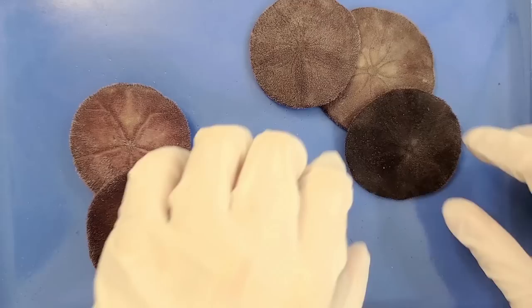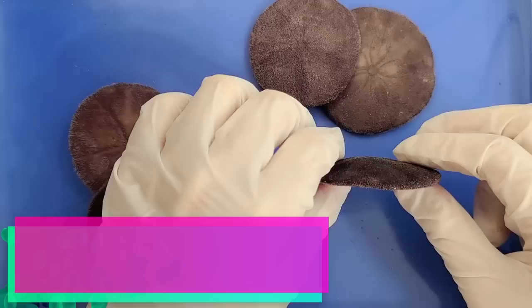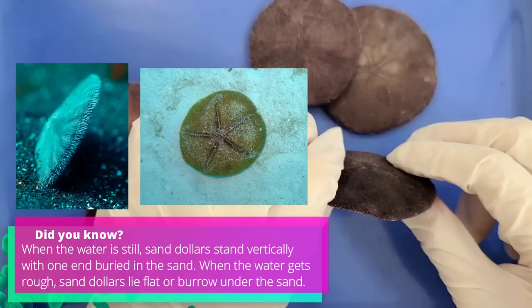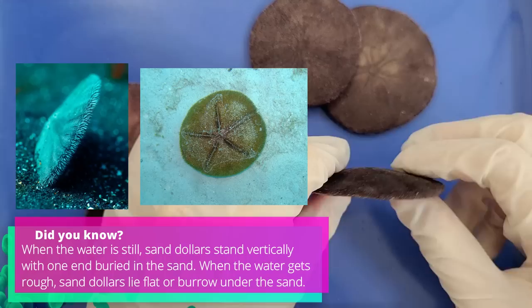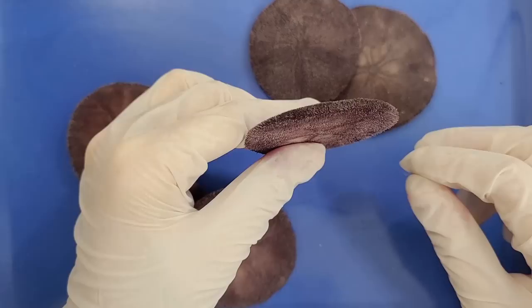Sand dollars have actually evolved to become flattened because they often burrow underneath the sand instead of traveling on top of it. Their flat shape lets them do this easily. Since sand dollars often live in harsh intertidal zones with waves crashing over them with a lot of force, burrowing into the sand gives them more protection, and their flat shape also streamlines their bodies so that they can withstand the waves.